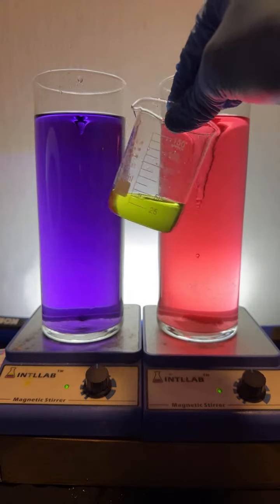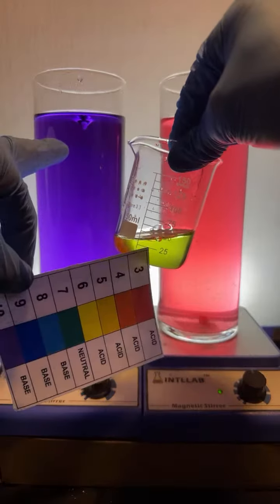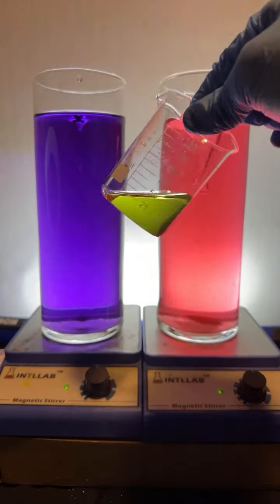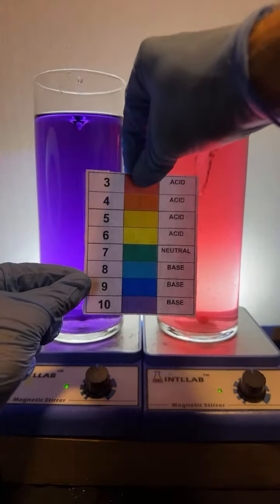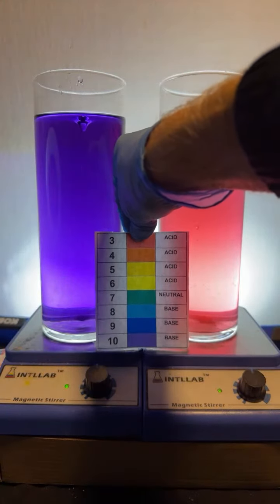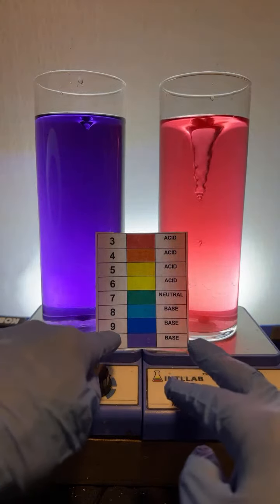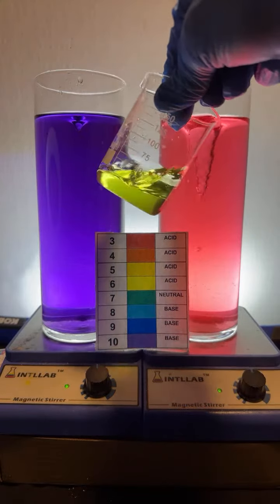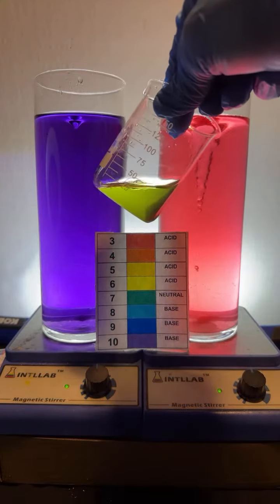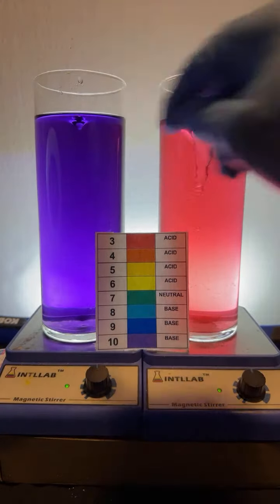So if you've been following along this live, you understand why when I mixed this violet solution and this red solution, I got a green solution. Basically, acid and bases neutralize each other. So the acid over here at pH 3 and the base over here at pH 10, when you mix them together, they make roughly pH 7. It's a little lower than pH 7. I'd say this is slightly acidic, but that's probably because the acid concentration here is a little higher than this.